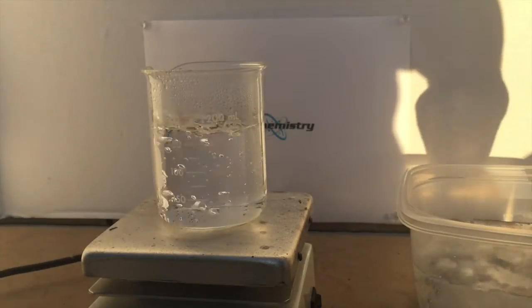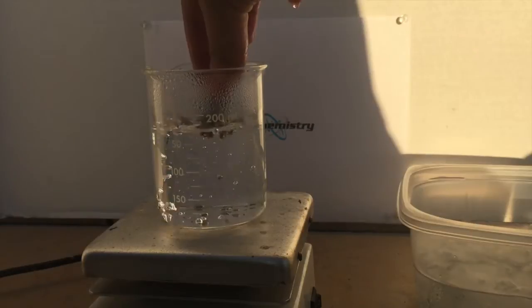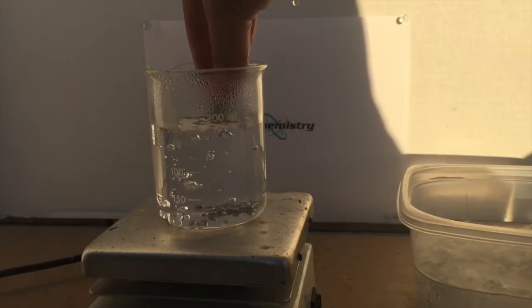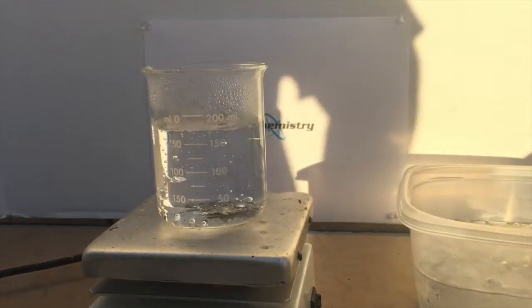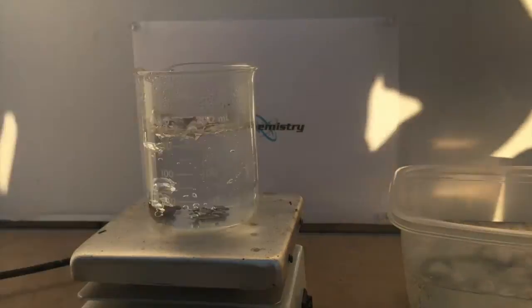Alright, this piece looks decent. Now let's just put it in the boiling water. As you can see it's melting, so we've lowered the melting point of the four metals together. Now let's add all the Wood's metal alloy inside.